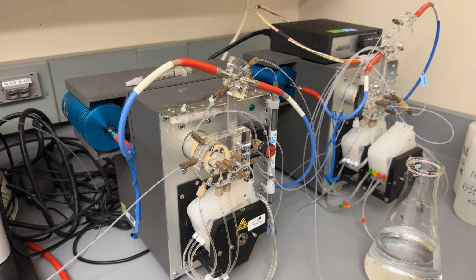The way that ammonium is measured is using an IPB, that's indophenol blue, salicylate method. Similarly, it takes the sample in, mixes the sample with reagents coming from the sample tubes, and puts it through a flow cell that measures the blue color development and records it on the spectrophotometer. This one doesn't have a reduction column. It does have a heating cell that changes the temperature in the coil here so that the color development is really consistent, because the color development is temperature dependent.